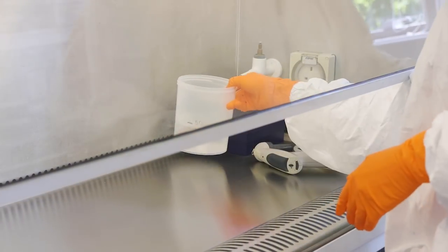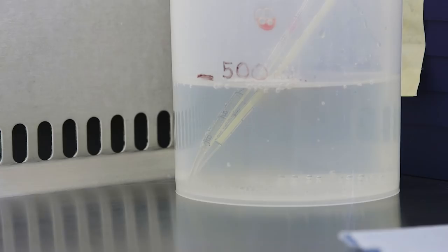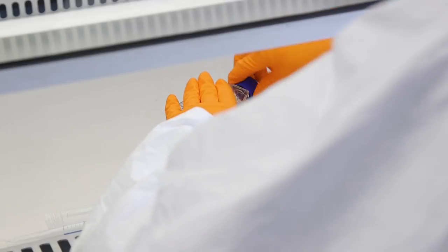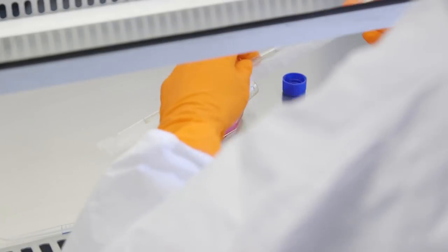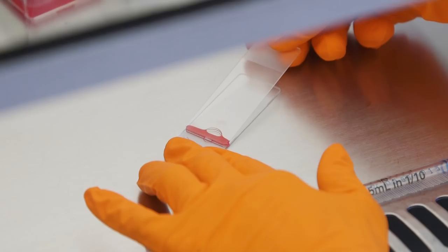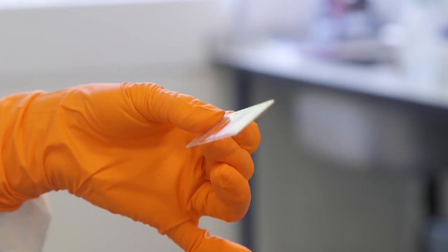In the hood, we have bleach containers to dispose of anything that has been in contact with the parasite. We take a sample of the culture, put it on a slide and smear it, then let it dry.